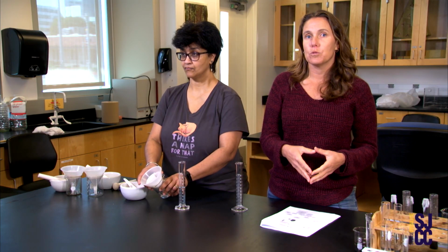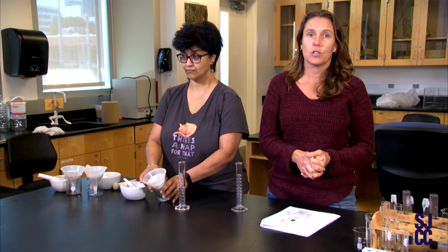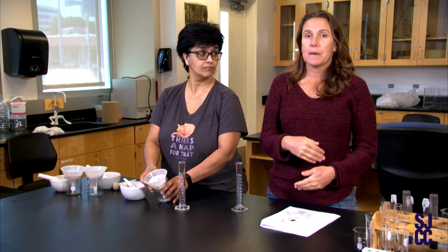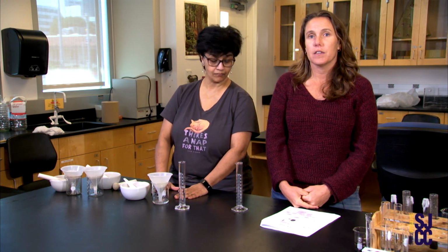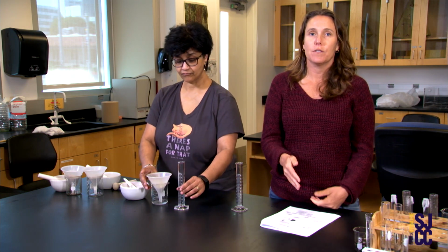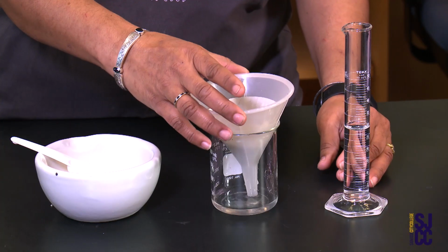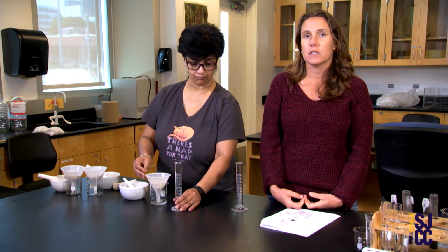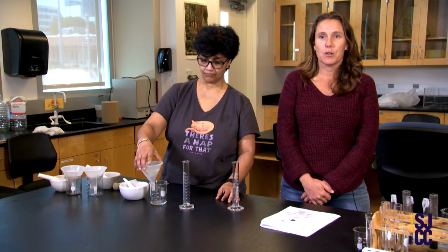So certain plants will do fine in this type of environment, like succulents, but other plants will not do great, especially those that need a high amount of water. So Sanhita will be calculating and measuring how much water was retained in the sand right now. We basically put 30 milliliters of water in each of the substrates and let it settle out for a specific time. And then we are going to take the remaining water out to see how much water is left in the sand. Right, so she'll be directing and looking at the measurement right now.